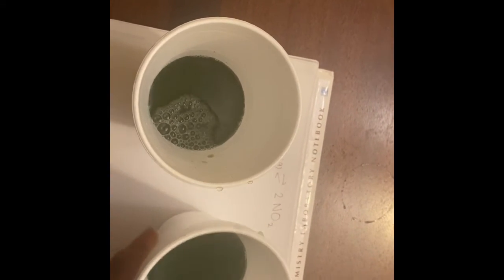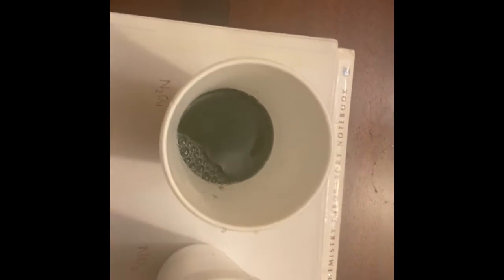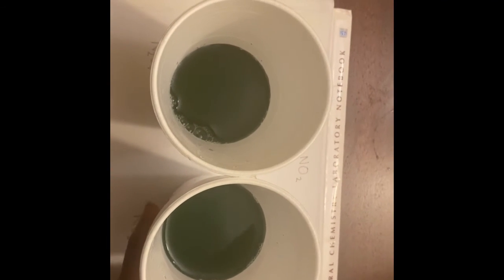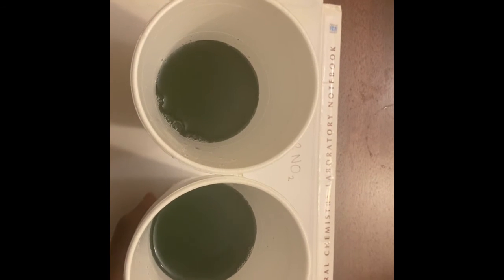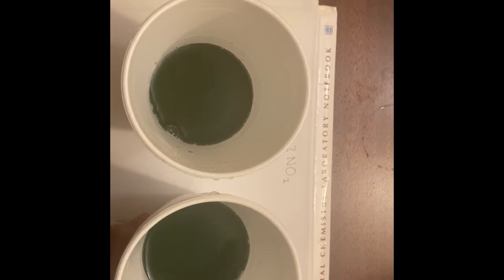It'll keep going, and notice how eventually both the liquids are now the same color. This basically proves the principle in that since both the colors are subjected to change, the system worked in order to minimize that change, causing both the colors to be the same.